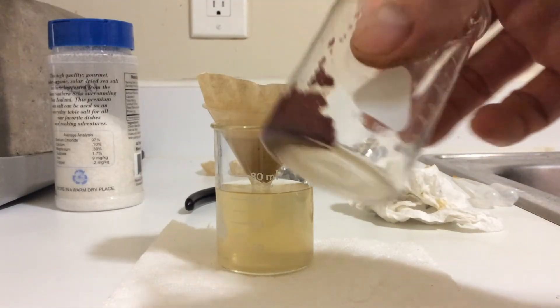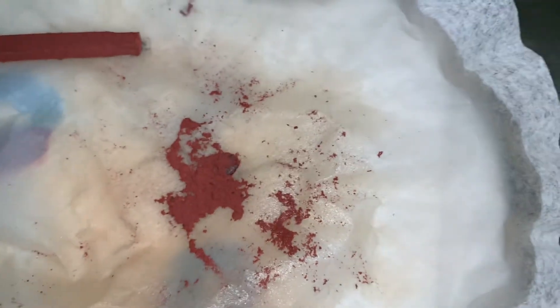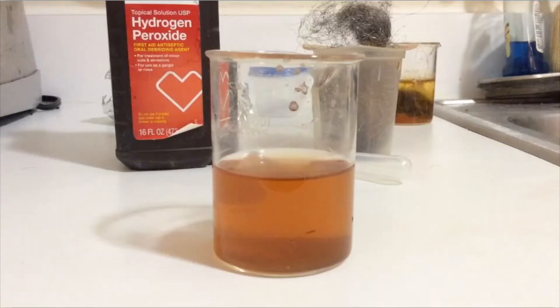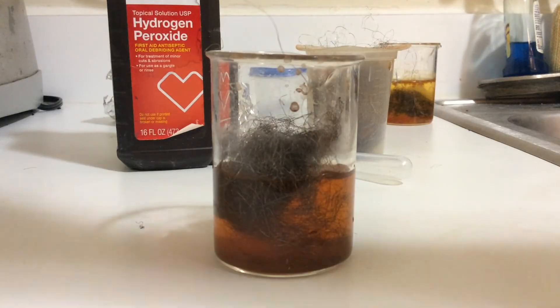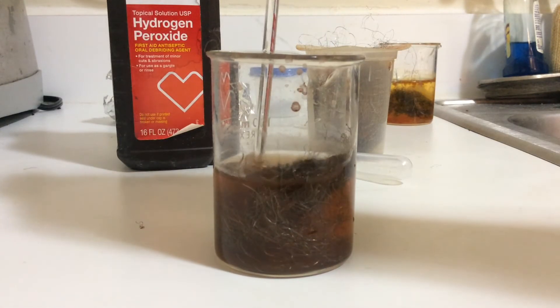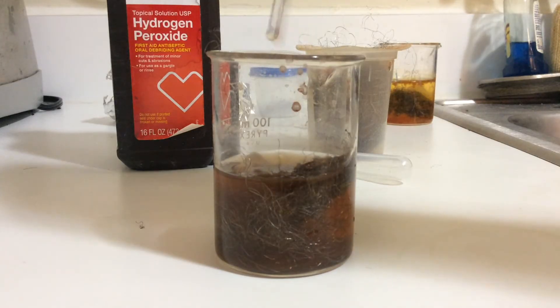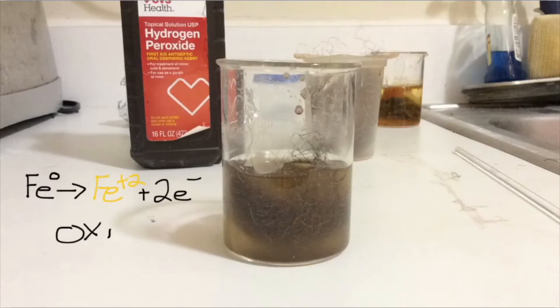Spread out, the copper looks nice and bright red. The solution is a mix of iron(II) and iron(III) ions. Here's a fun side experiment: if we add some steel wool — which is just elemental iron — to the solution, we see that the iron is being oxidized to the plus-two state, and those electrons are actually being received by iron(III) ions, reducing them to iron(II).